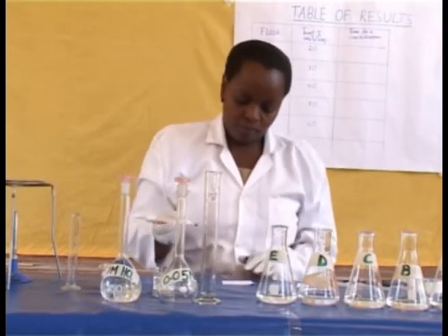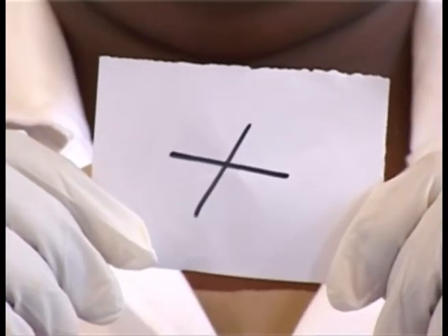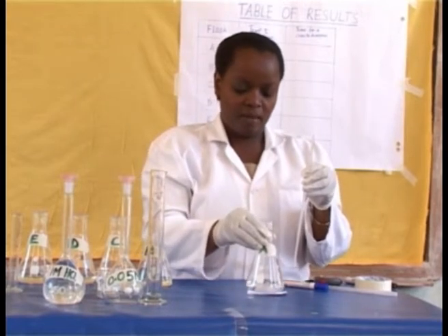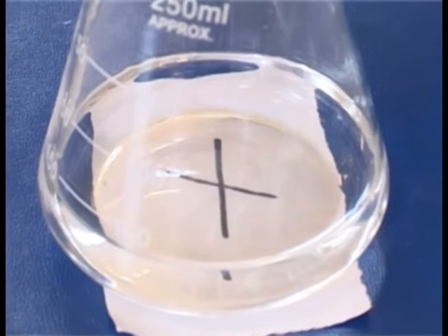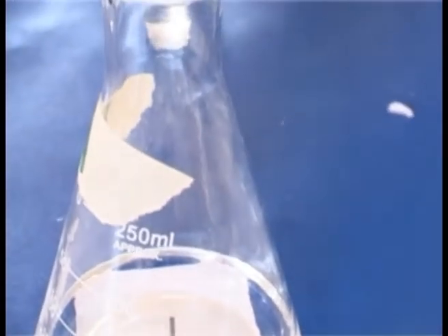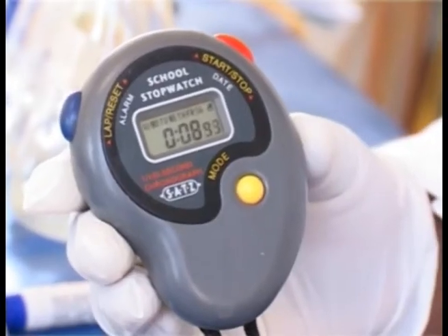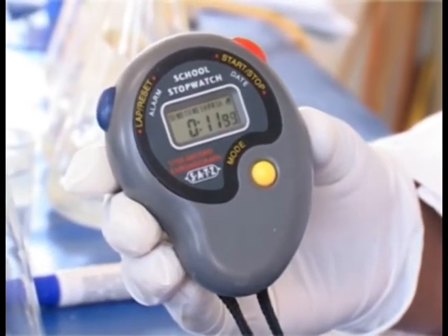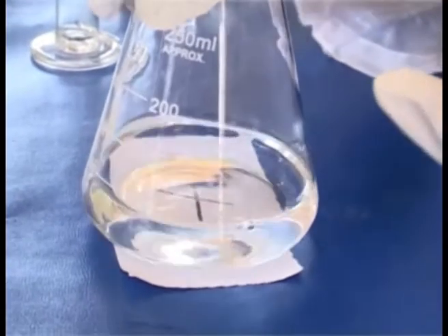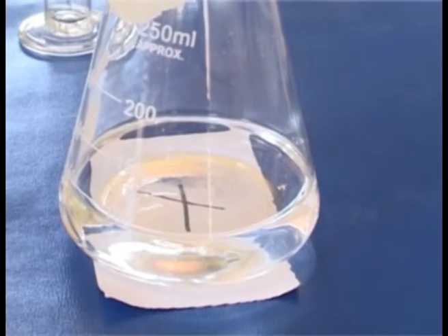Draw a cross on your piece of paper. Add 10 ml of hydrochloric acid solution and immediately start the stopwatch. Look into the mixture from above and note the time it takes for the cross to disappear.